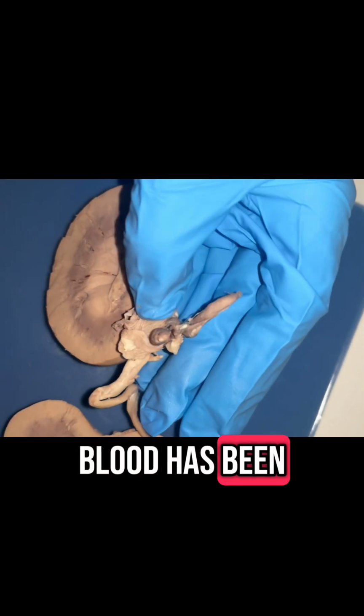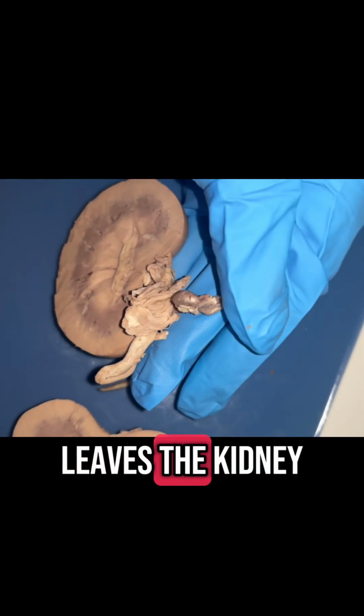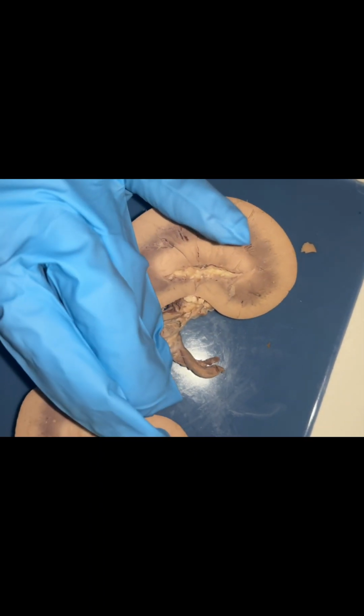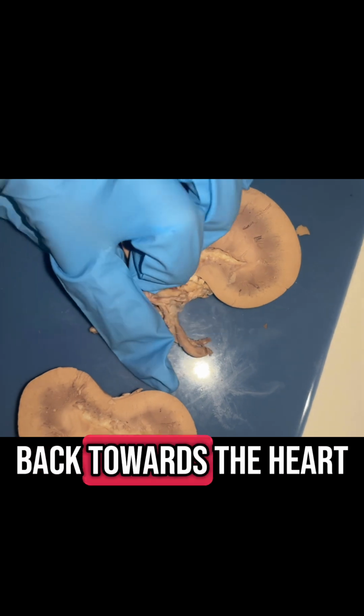So after the blood has been filtered out of the kidney, the cleaned blood with the removed waste leaves the kidney through what we call the renal vein, and it drains into the inferior vena cava, which carries blood back towards the heart.